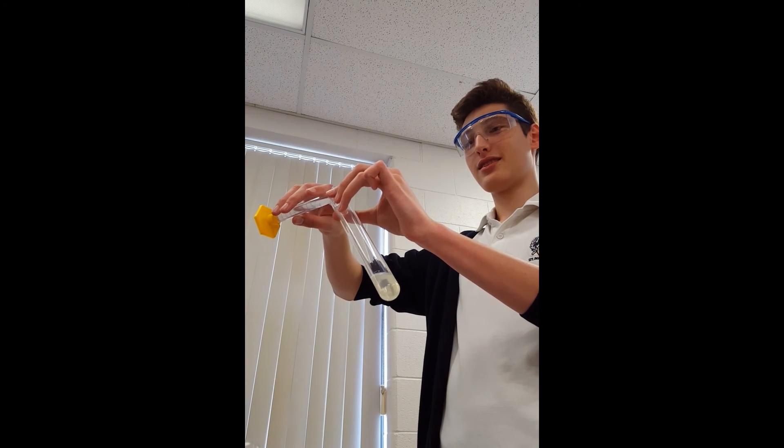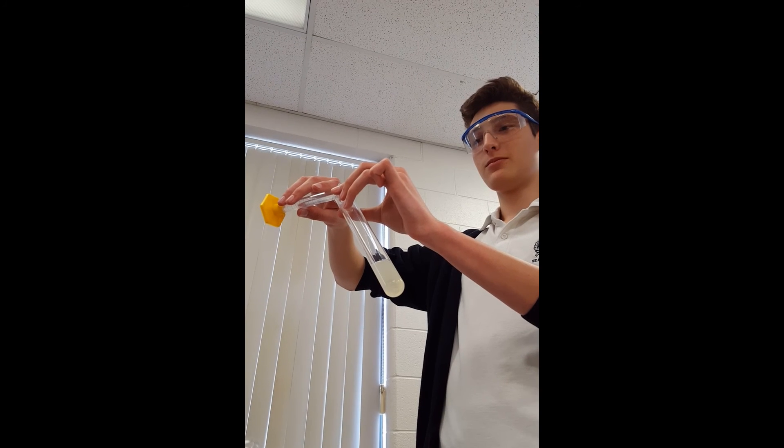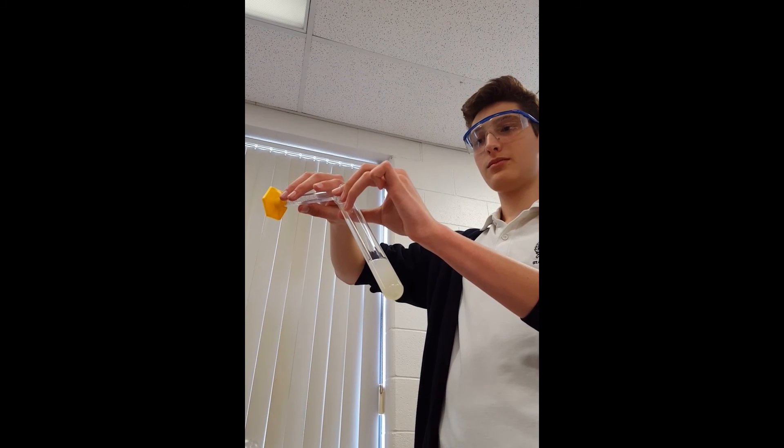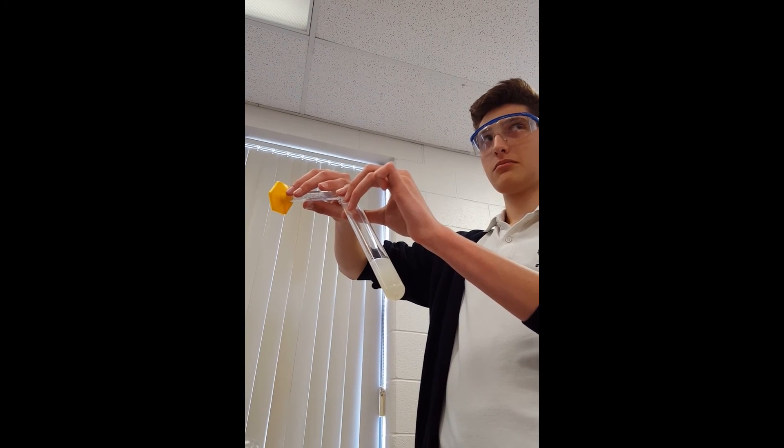Once it's introduced to the alcohol, it's forced out of solution and forms solid strands which we see as a white clump where the alcohol touched the DNA solution.